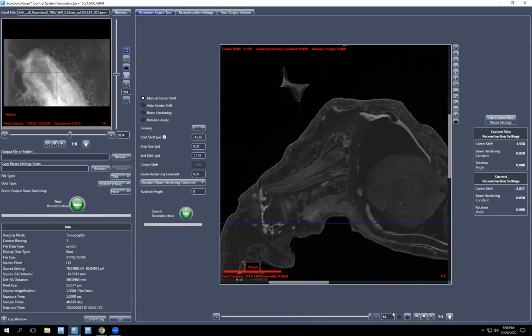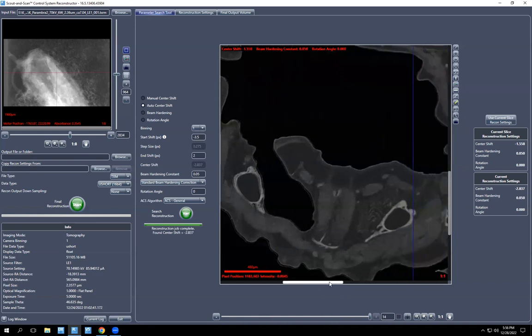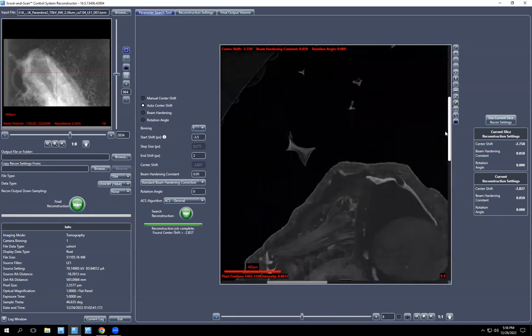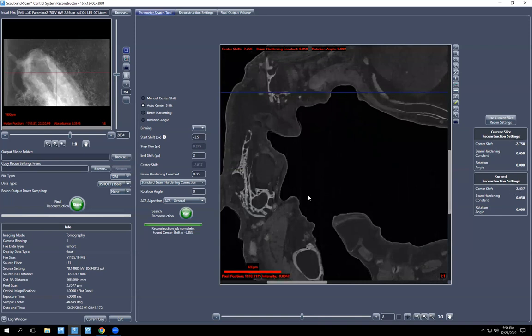That makes sense. Okay. So would you check the automatically reconstructed center shift again with the smaller range? Yeah. And smaller step sizes? Yeah, you can. And you can basically spend a bunch of time doing that, finding the correct one. Let me go back. Right, so I'm gonna keep this.